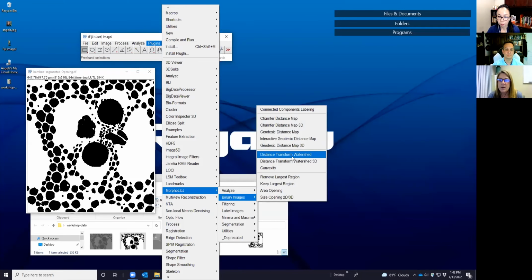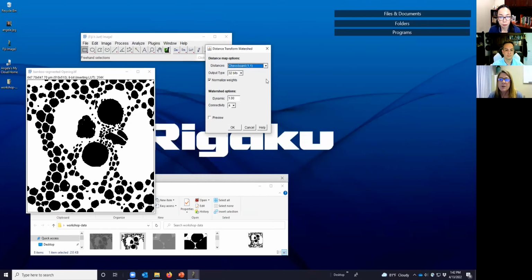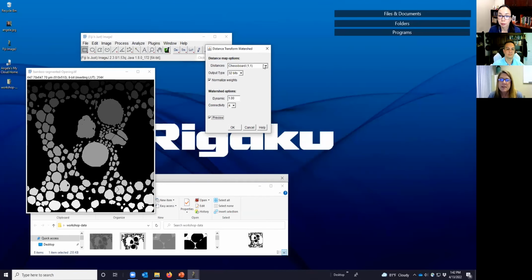And in this case, we can go directly to distance transform watershed, where it combines both actions. If instead you wanted to calculate a distance map and then go on to perform the watershed, you can do that. So these operations are up here. But we're going to go straight for the distance transform watershed. And in this case, we're going to preview exactly what happens with some of these. Remember, our output is going to be a grayscale image. In this case, it's 32 bits. And this is the output that would happen with the chessboard distance.